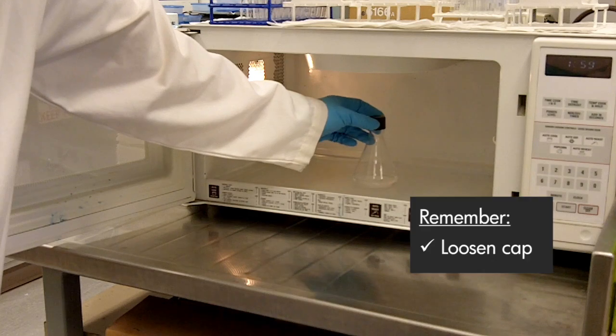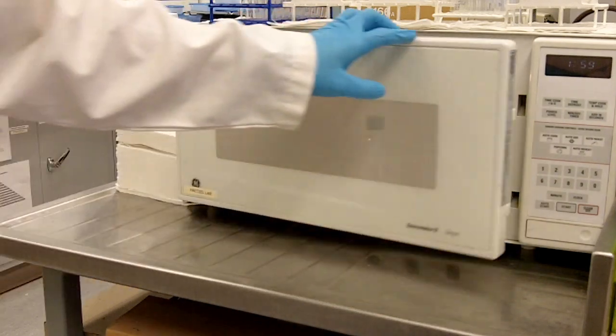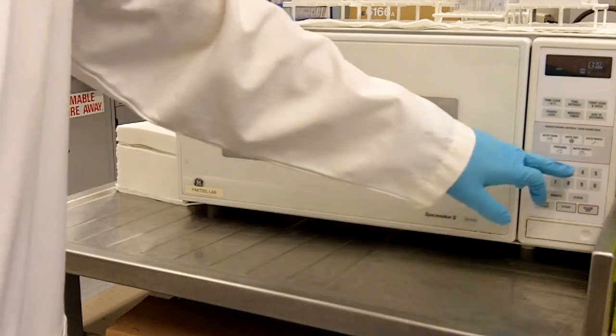Second most important thing is that you want to loosen the cap so the flask doesn't explode and that's it. We'll just heat it up for about 45 seconds.